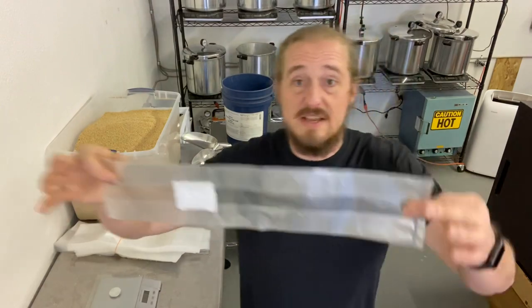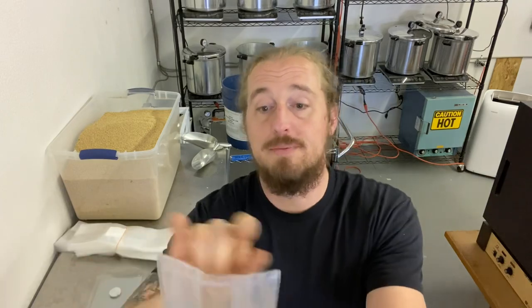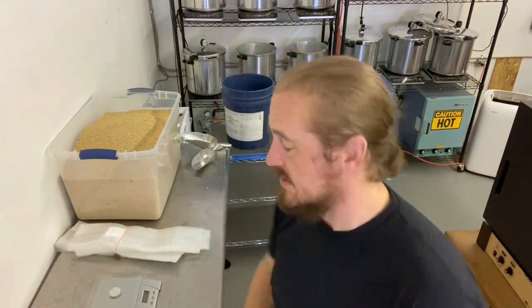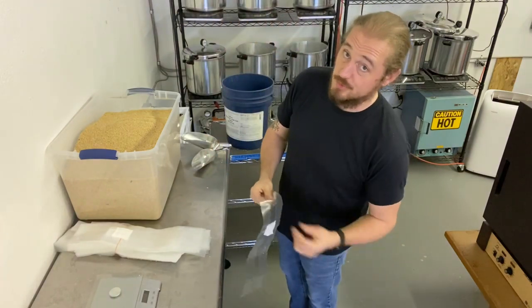Now we're going to go and get one of these bags. This is a 14-unicorn bag - it's about four inches across, really long. They're over on a shelf with the other unicorn bags. Now, the recipe. This is real simple.